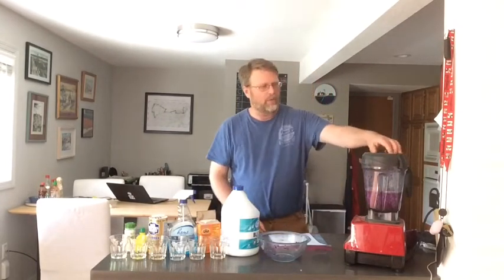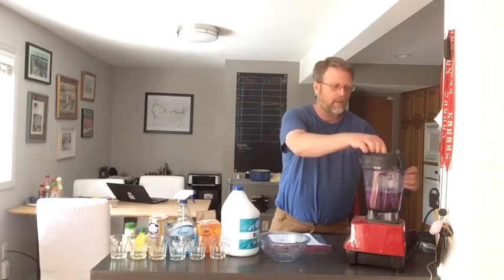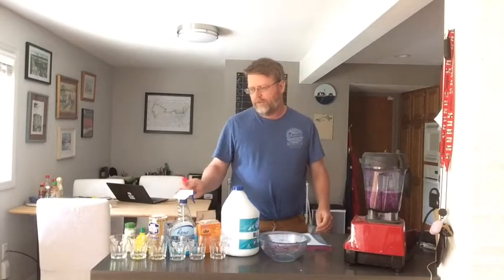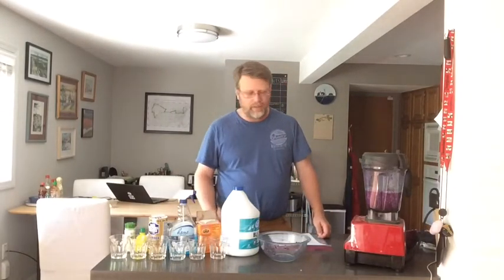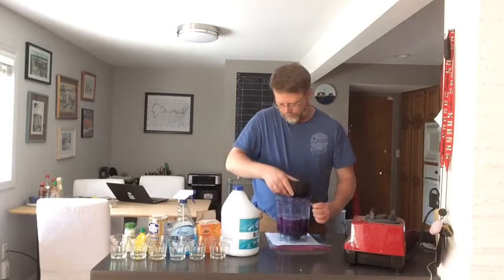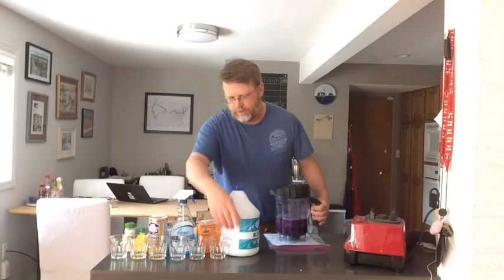I'm going to filter this a little bit and pour it into each of the glasses. I'll then add five milliliters of each solution — or solid — to see what the pH color indicator shows. Let's open this up and start pouring into each glass.